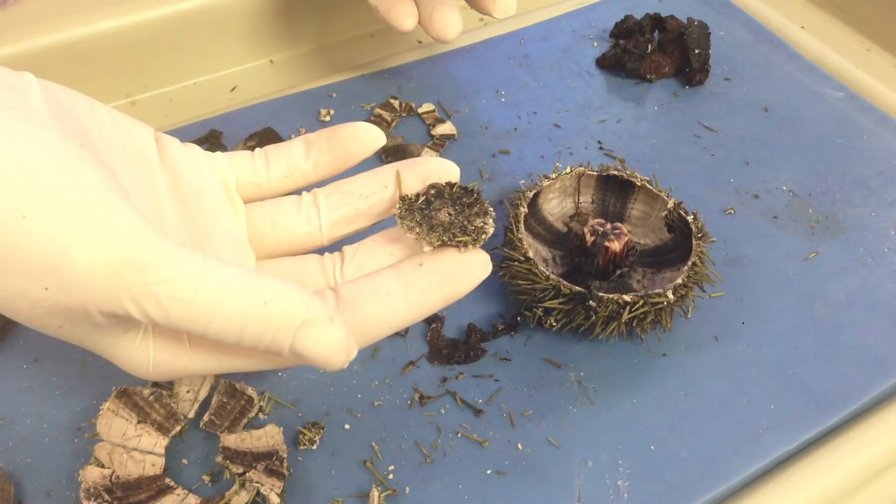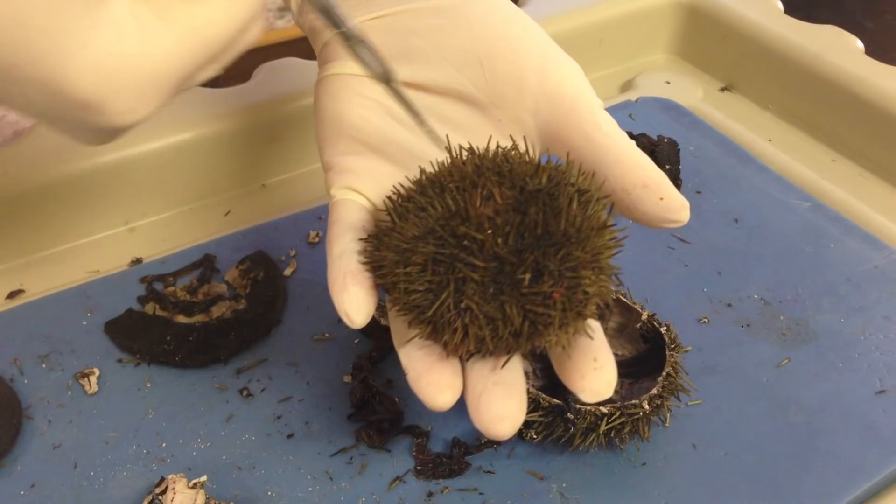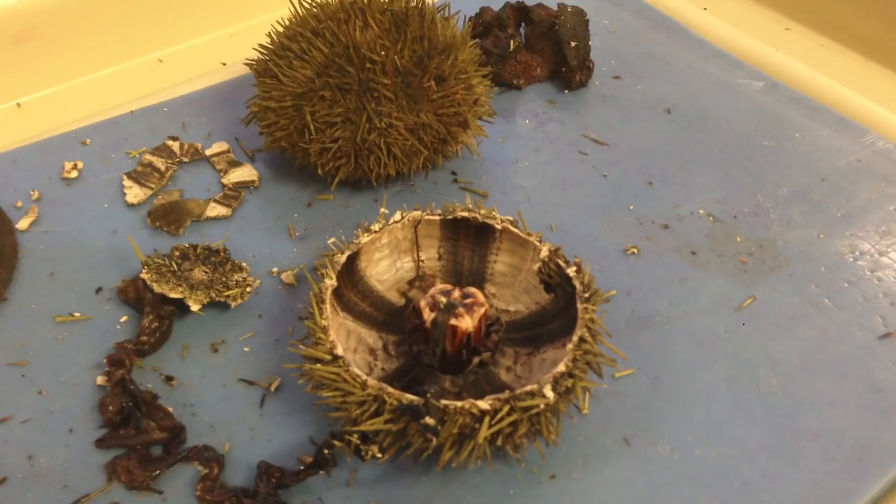After I've created that small circle around this area, I went ahead and took my scissors and went down the sides and then around the center — so I essentially took off a sphere. And once I was done taking the sphere off, you can see this half of the sphere as well as the top half of the sphere. You guys understand the difference there?